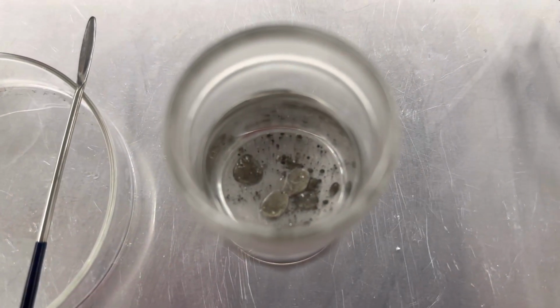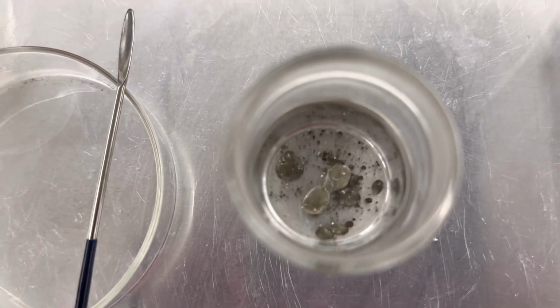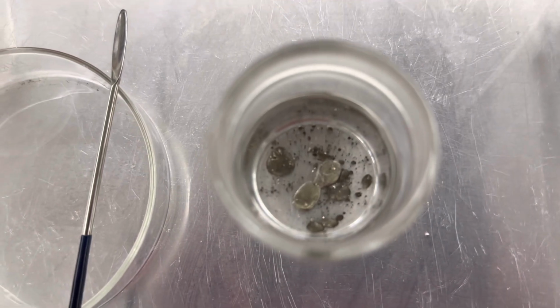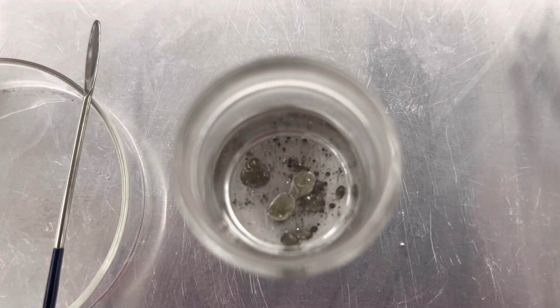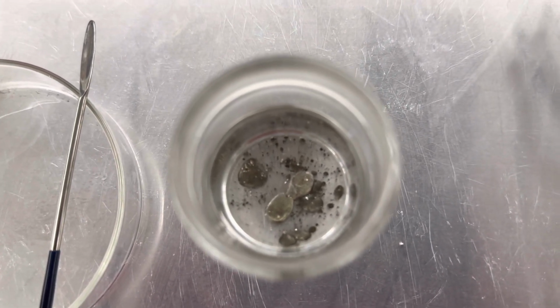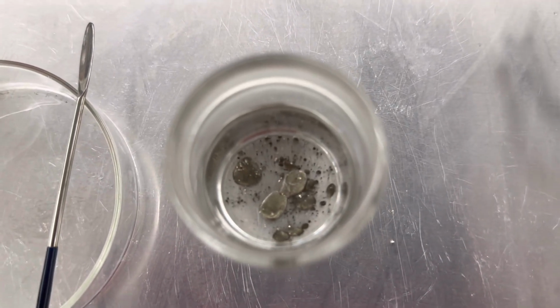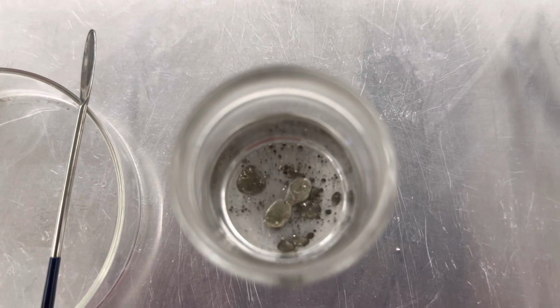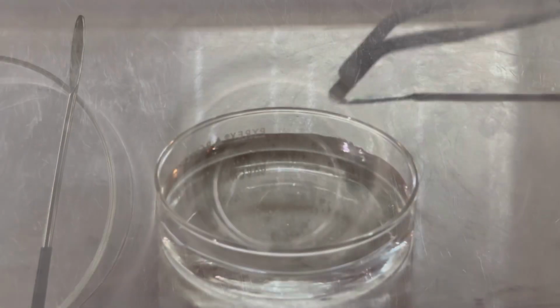Now, since cesium is such a soft alkali metal, I should be able to use this spatula to cut a very small piece of cesium and add it to this petri dish of water, and that will create hydrogen gas and cesium hydroxide. Now, the hydrogen gas is going to get so hot in this exothermic reaction that it'll be ignited by the heat of the reaction as the hydrogen is liberated from the water. Check it out.